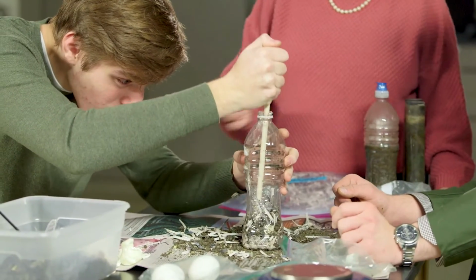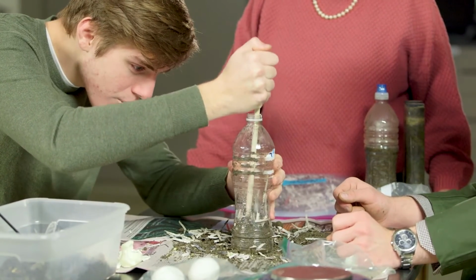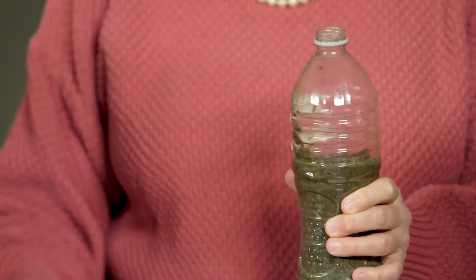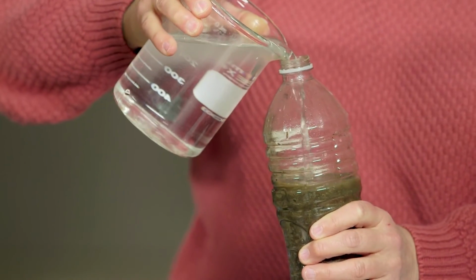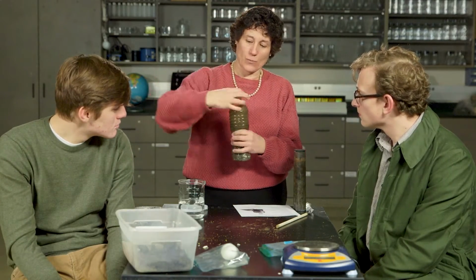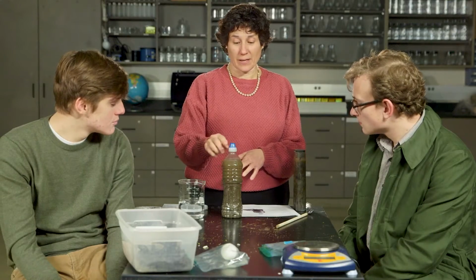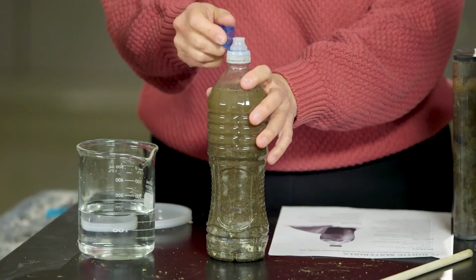And notice that it does take a significant amount of soil to fill a bottle. So now that we've filled the bottle with our compost material, we're going to fill the rest of it as close as we can get to the edge of the cap. And we're going to pour our pond water in. Then we want to put our cap on, and we would seal it with masking tape. And the nice thing about this bottle is that as you're doing your observations over the next week or 2 or 5, depending on how long you want to leave it set, you can actually let the air escape.